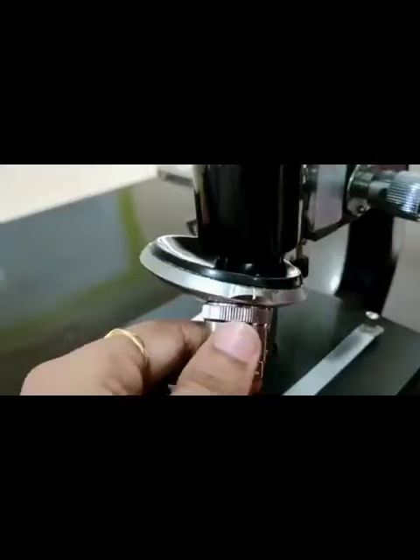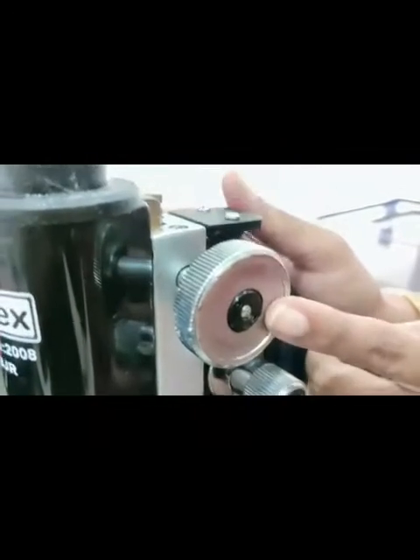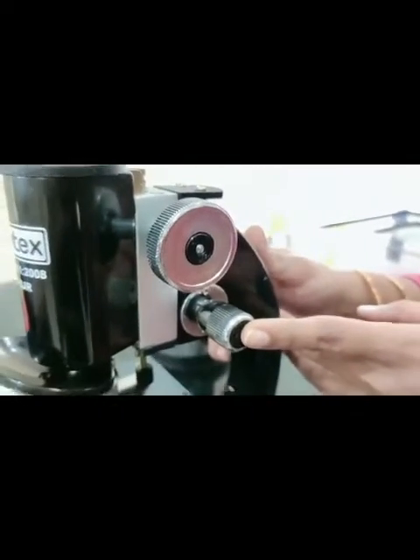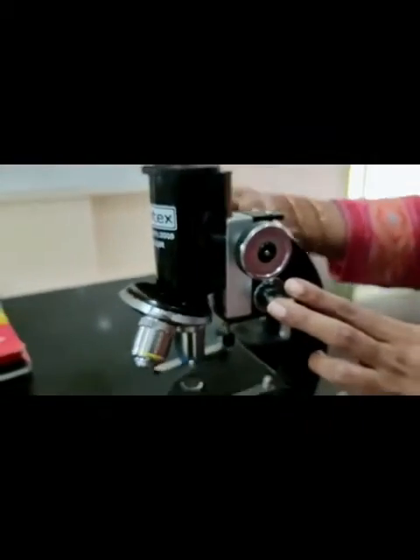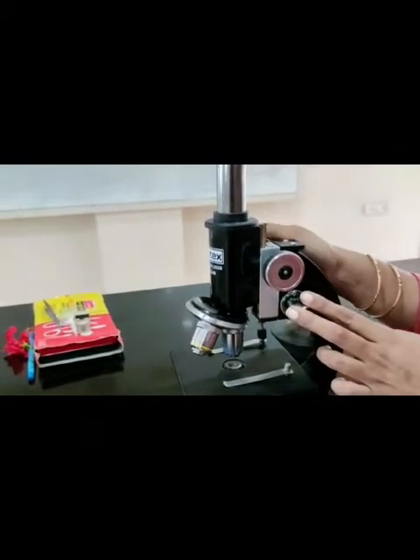Then there are two adjusting screws. This is called the fine adjustment screw and this is the coarse adjustment screw. When you use the microscope, you don't need to touch the fine adjustment screw because the setting is already done. Only to adjust the slide we are going to use the coarse adjustment screw. With the help of this we can move the tube up and down, and with the fine adjustment we can adjust the slide.